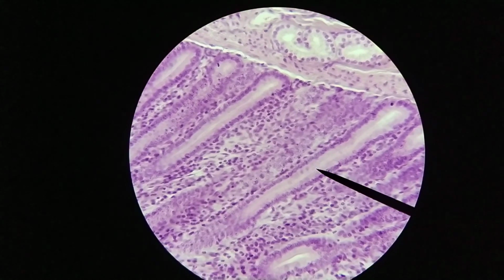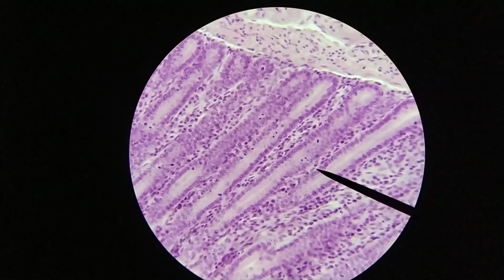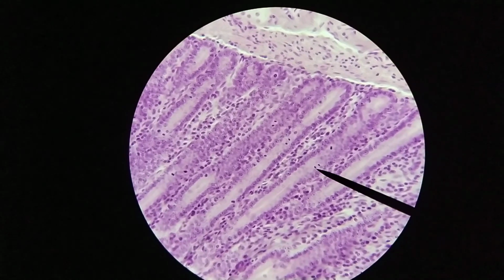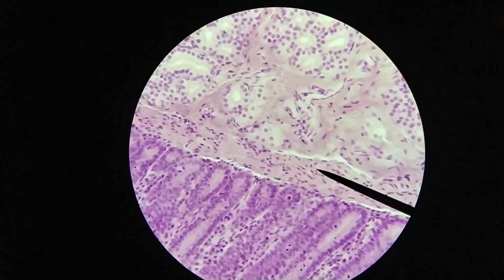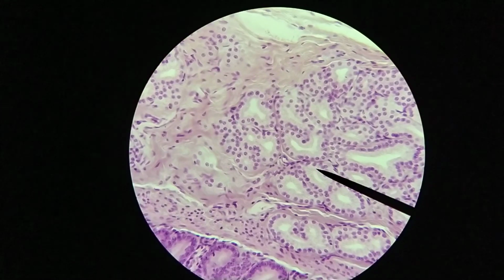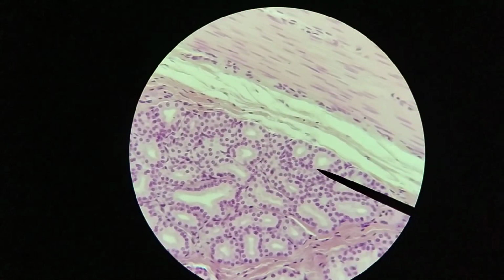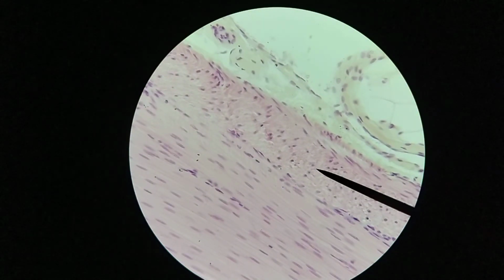So again, you can see that here as well. There's a lot of these cells that kind of look a little out of place. And again, what we're looking at here is a lot of cell division going on. Again, these are the stem cells that are found within these crypts. Okay, and again, what we have down here below the crypts are the muscle cells of the muscularis mucosae. And then beyond that, we have the glandular cells. And then beyond that, again, smooth muscle, inner circular layer, nice longitudinal section through smooth muscle, and then an outer longitudinal layer.